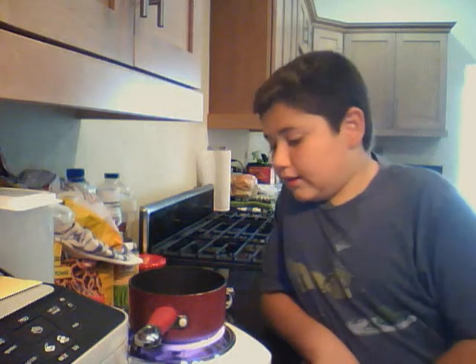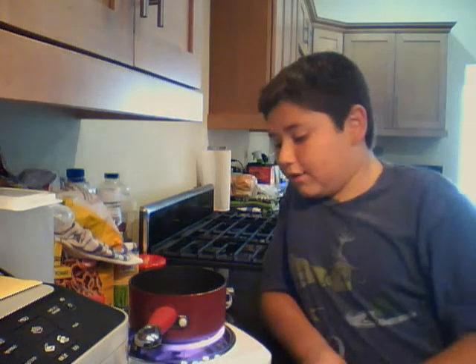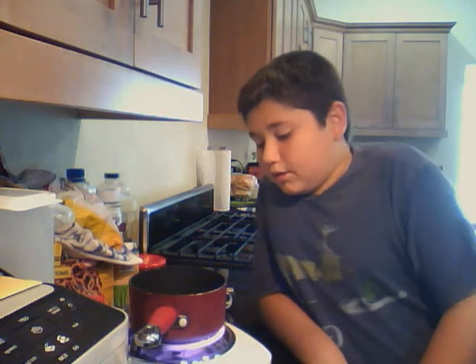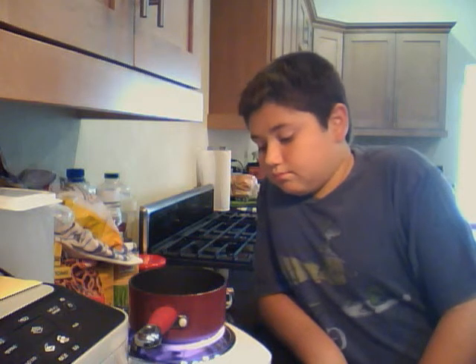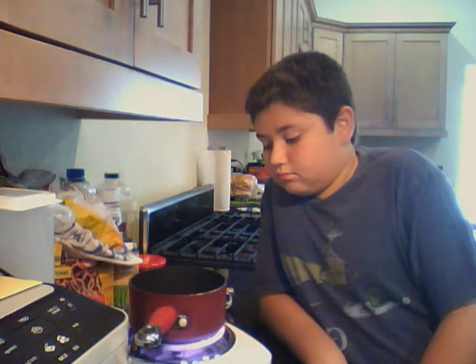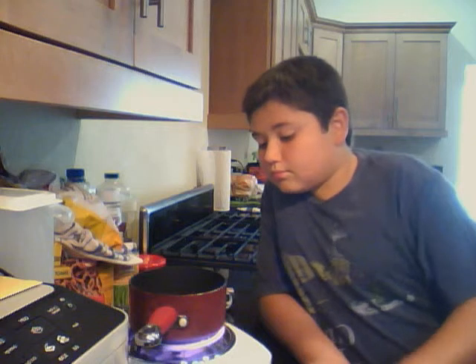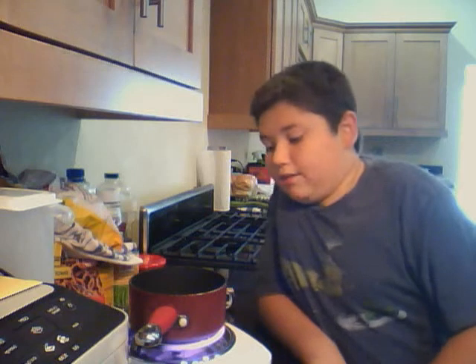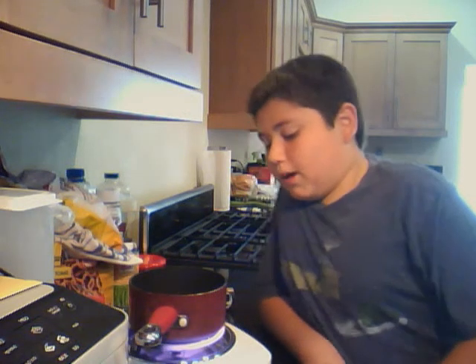So far it has evaporated down about this much. There are tons of bubbles popping up — big ones and small ones. It's about to evaporate very soon. Now it is very close to being fully evaporated; it doesn't have any steam anymore because all the steam has already left. It just has bubbles popping out of it.